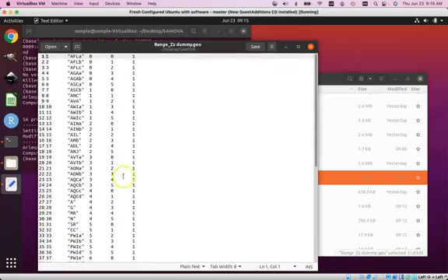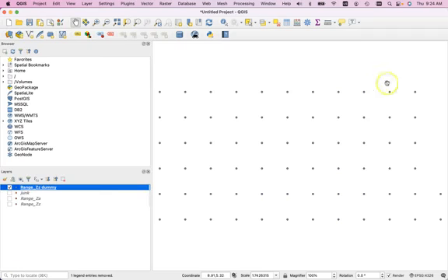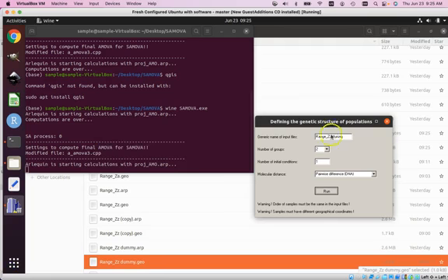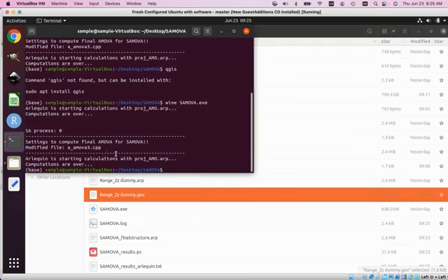And these data points are spread out. If we were to graph this, it would look very interesting. So with the fake coordinate data, the arrangement of the specimens on the landscape looks like this. So that's very, very artificial. But when you do that, it runs. So here it is, I have it running. So it runs. So this tells us a couple of things.